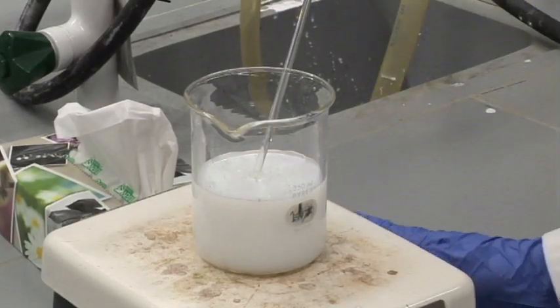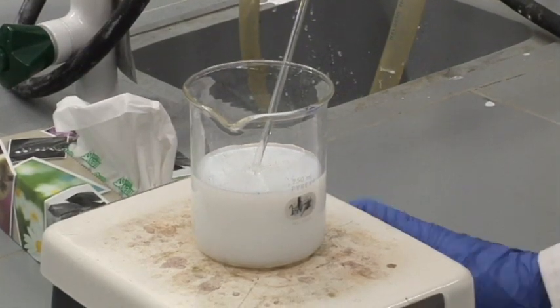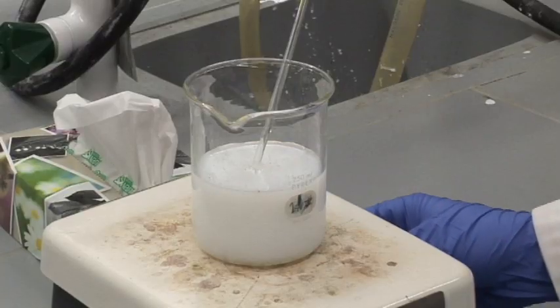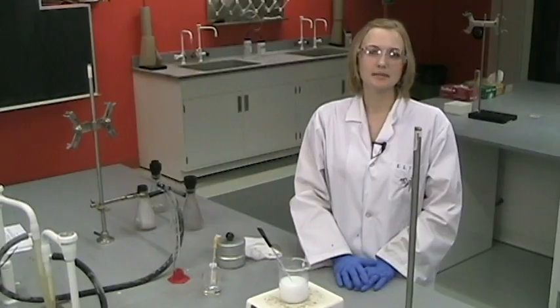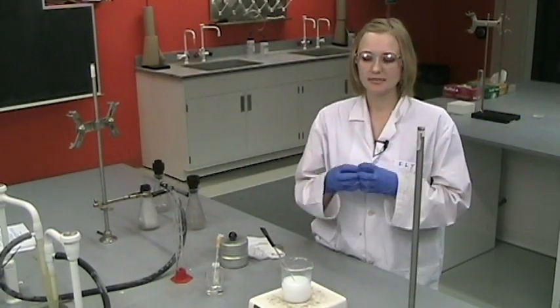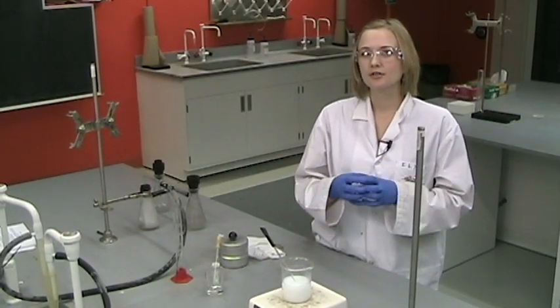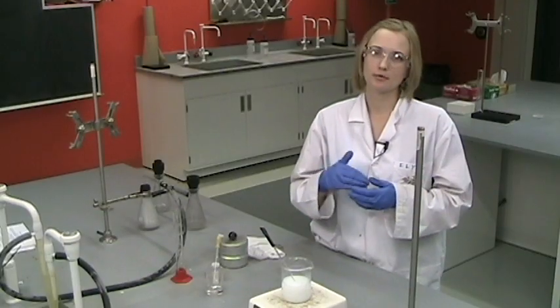So once that's formed, you will start to heat it up on a hot plate. You want to heat it up so that these very small particles will come together, coagulate and clump together, so that when you filter your salt, it will not pass right through the filter.